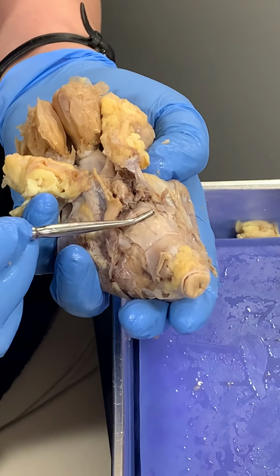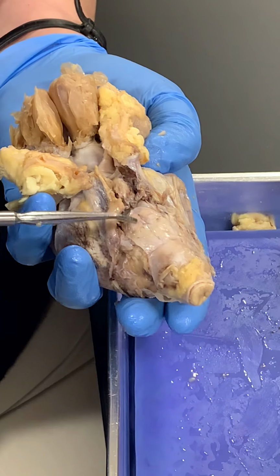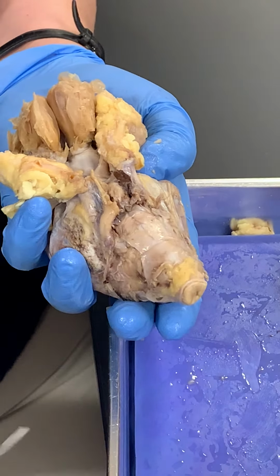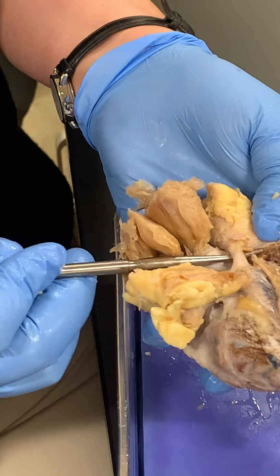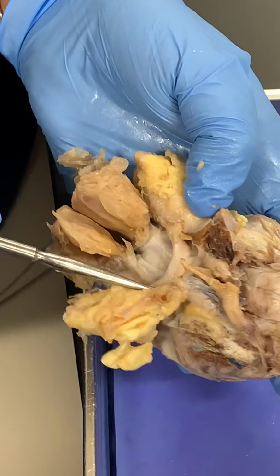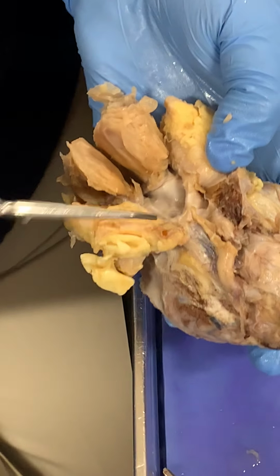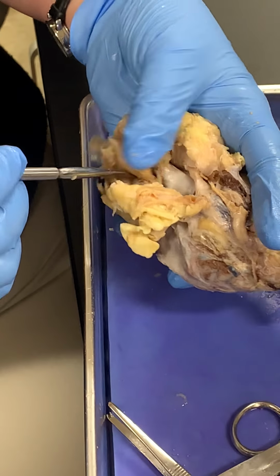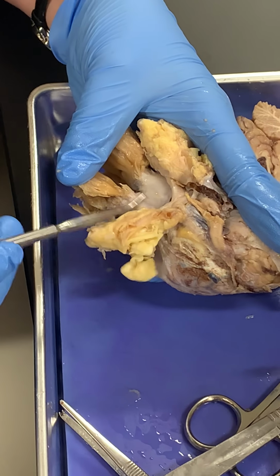You can just make out the brainstem, but to be able to see the difference between the pons and the medulla oblongata, it's best to have the dura removed, so I'll show you a different spot for that. And then here you can see an optic nerve, and where they cross underneath the dura is the optic chiasm. The olfactory nerves, or cranial nerve number 1, is under the dura here.